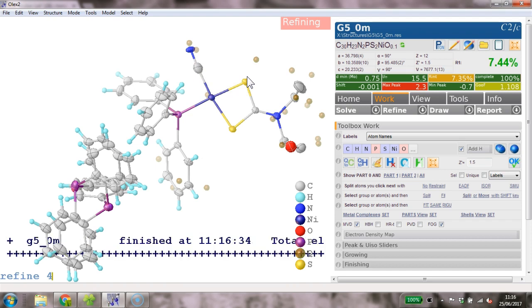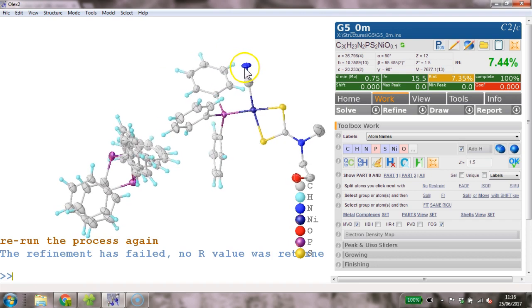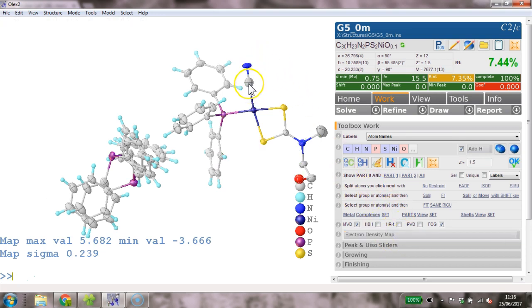And yeah, that looks slightly better. It's not ideal though. I agree that this is a bit strange. Yeah. What are the occupancies on this thing? They are 1, so that's fine.